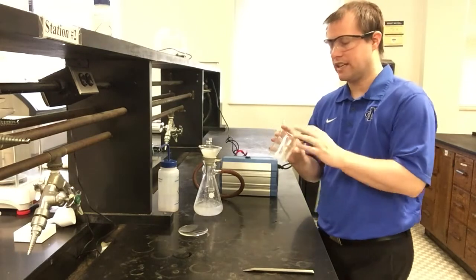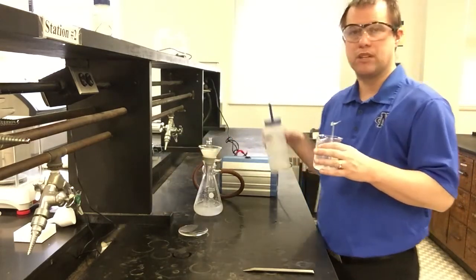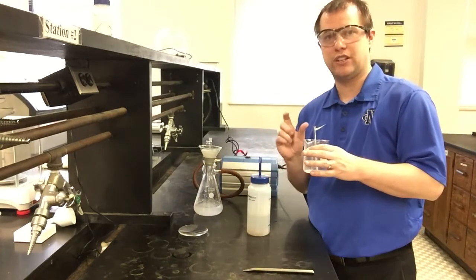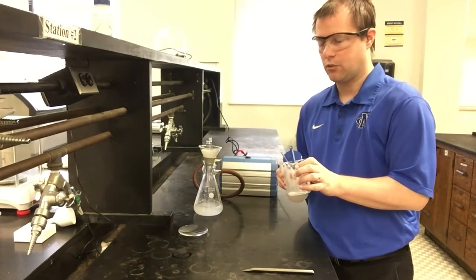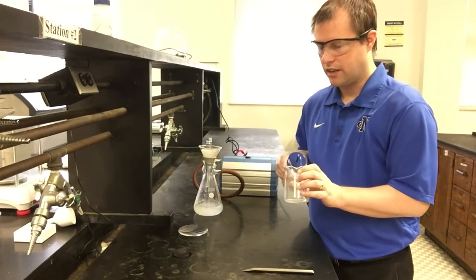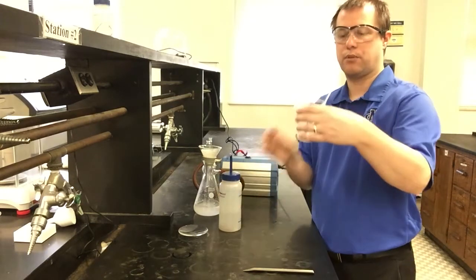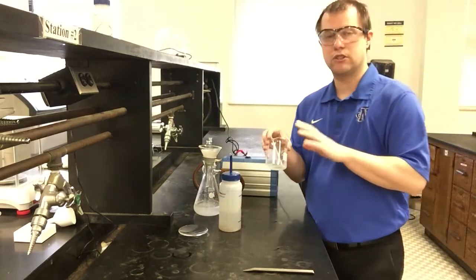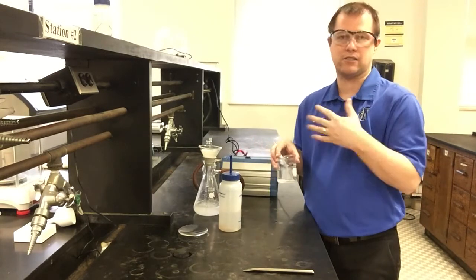So to get this last little bit out, you can take a little bit of water, ideally either room temperature or even a little bit chilled in an ice bath. I'm just going to squirt this through the sides and the edges, trying to get out that solid that's still in here as product, so that it can stay suspended in the solution and it's easier for me to pour it all out so that it can get collected.